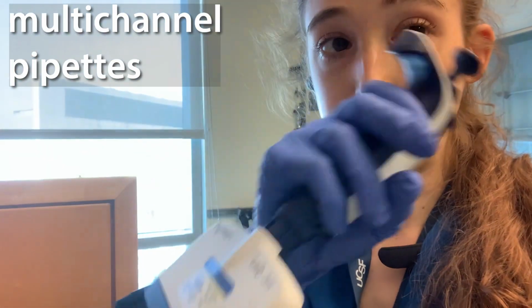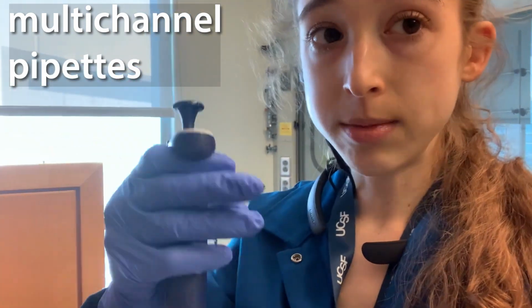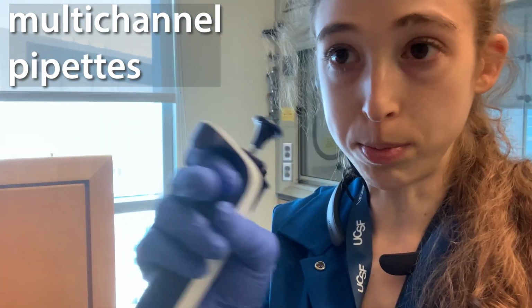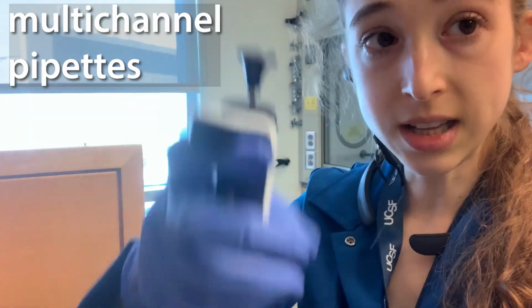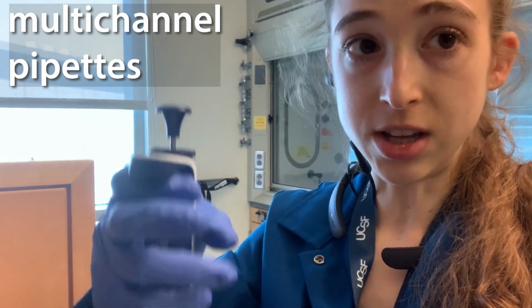So you want to make sure that you have an even distribution, and then also when you're drawing up the liquid, you want to make sure that the lines of the liquid are even. Sometimes some of them will be off. This can happen especially if you're using a well or something and there's a bubble in one of them. So what you want to do is go up and down gently to try to get rid of the bubble, so that you have them all at the even volume.